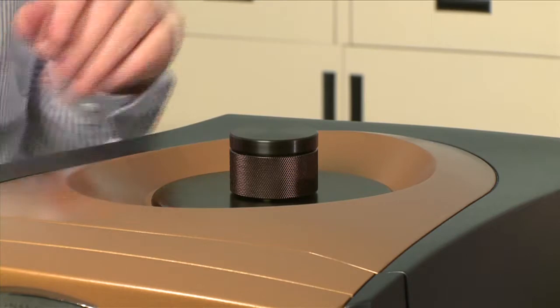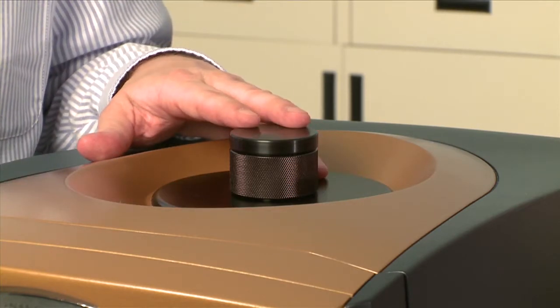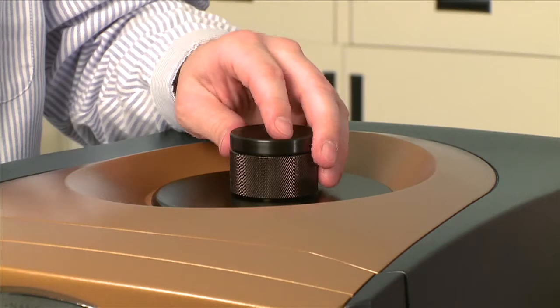Before cleaning the NanoDSC, you want to make sure first to depressurize the system through the software, and then you can open up the pressure cap.